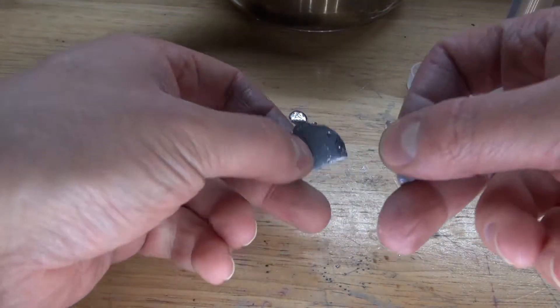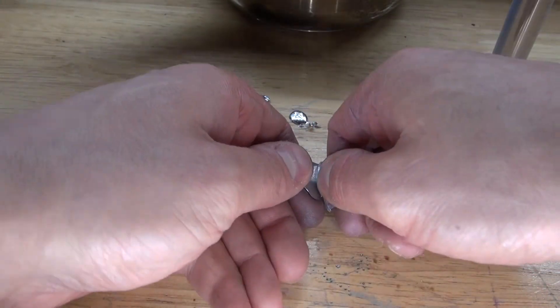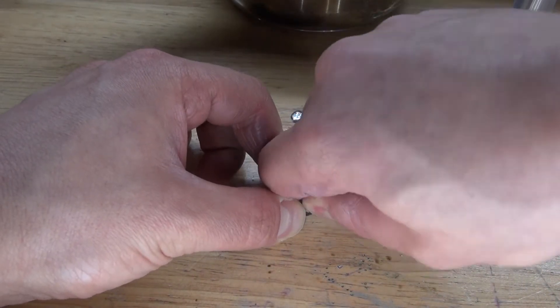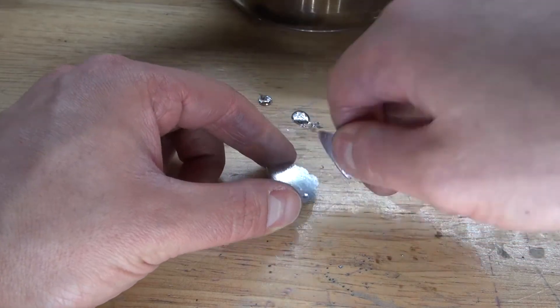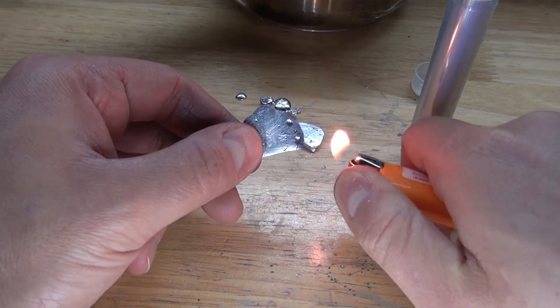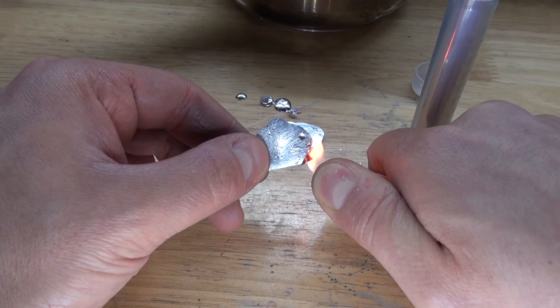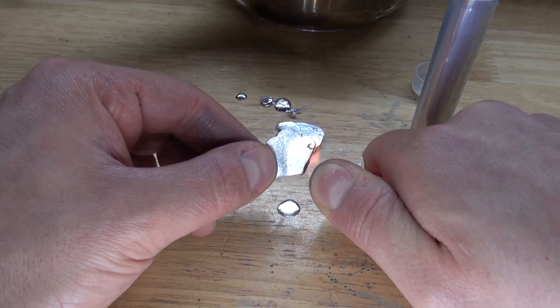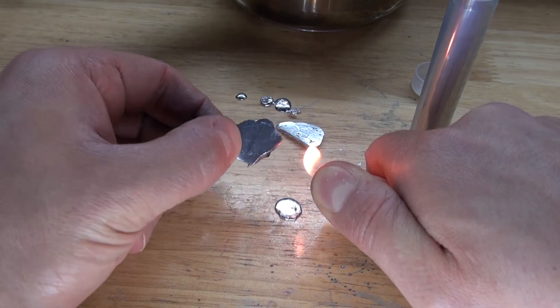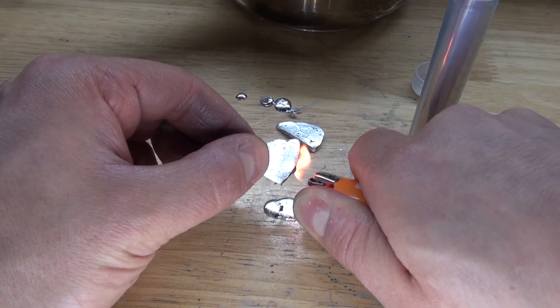Can I cold weld it like indium can do? Nope, I cannot cold weld it. And I'm going to see if I can melt it like candle wax and see what happens. Oh, it melts just like candle wax. How amazing. It's a poor conductor because the whole metal is not getting hot as I do this. You can see that it drips like candle wax.